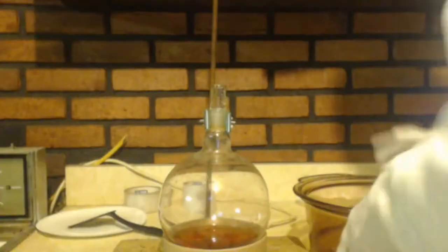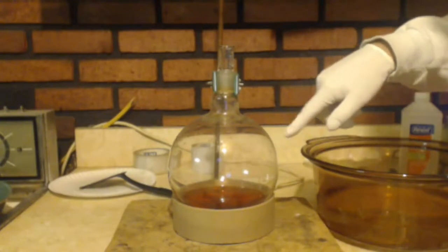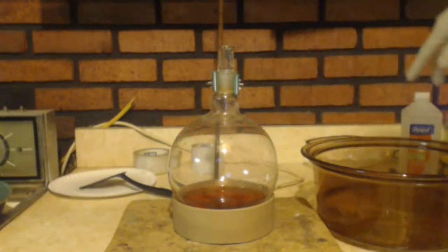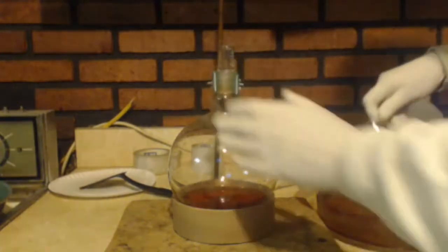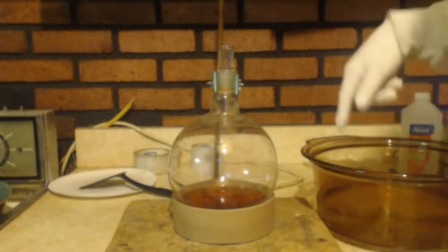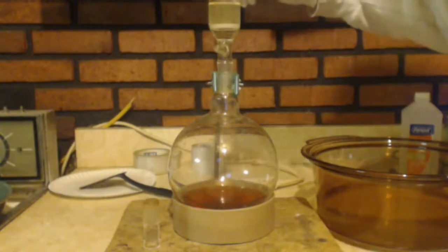You can see, remember that I had the little tiny filter thingy. Look at it. It's nice and clean. There's no iodine on it anymore because I put it in this sodium hydroxide solution here. Now what's in here? This is the water that I filtered through the iodine to clean it. So there's iodine in there and it's water. What I want to do, since this does have some iodine in it, is try and put it right in there.